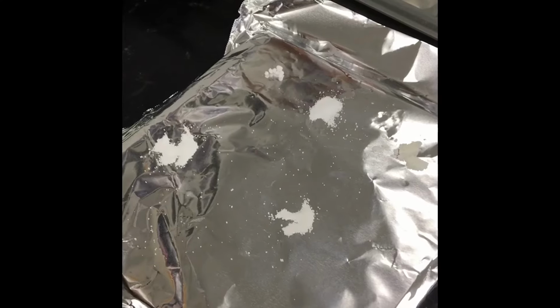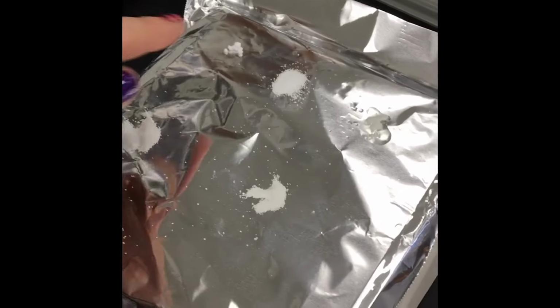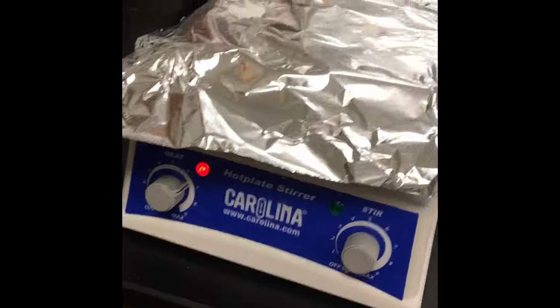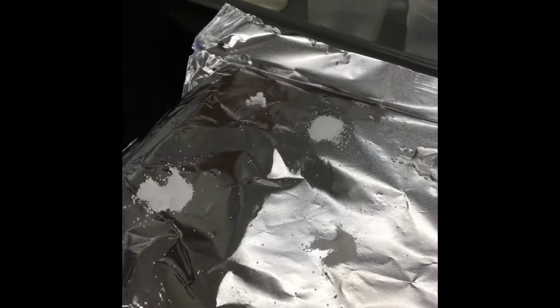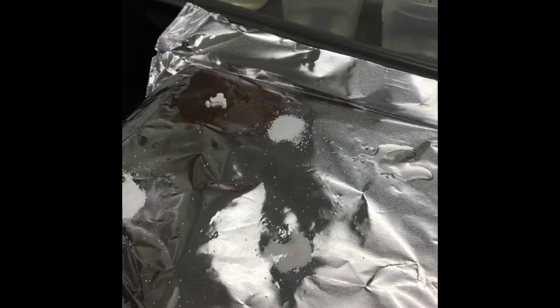And next we are going to heat it and test the melting. Next we're going to do the relative melting point determination. So with my 5 samples, I'm just going to put them on the hot plate here and turn that on. And I'm going to watch and see which one melts first. So whichever one melts first, I'm going to label as number 1. The second one I'll label as number 2, the third one number 3. And if it doesn't melt, I'll just put an N for does not melt.